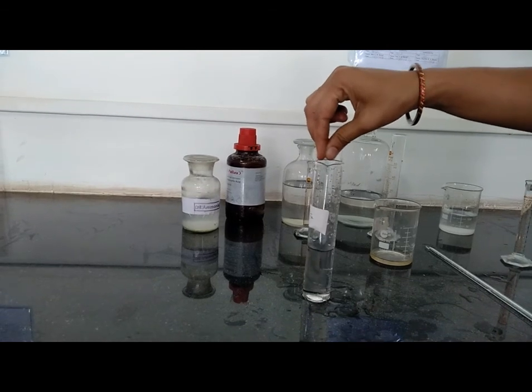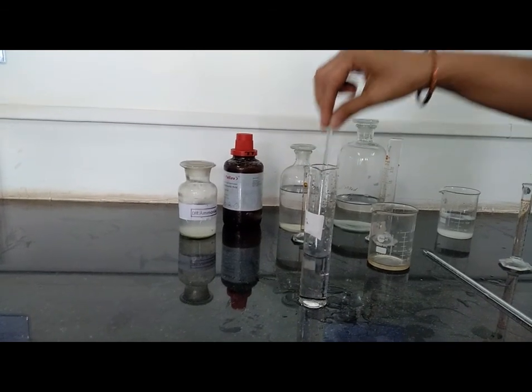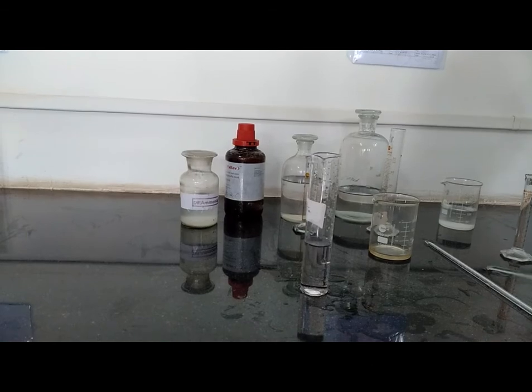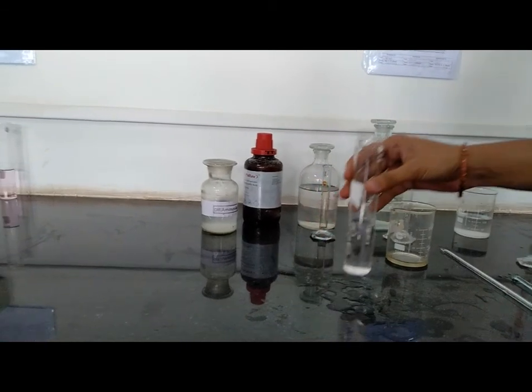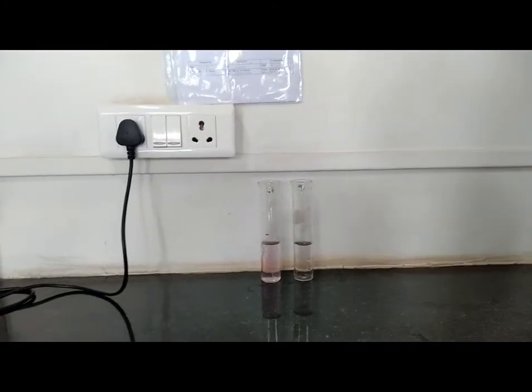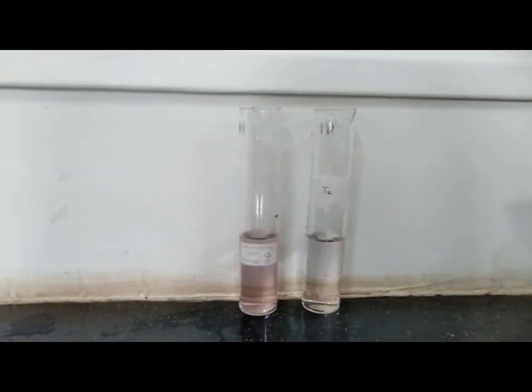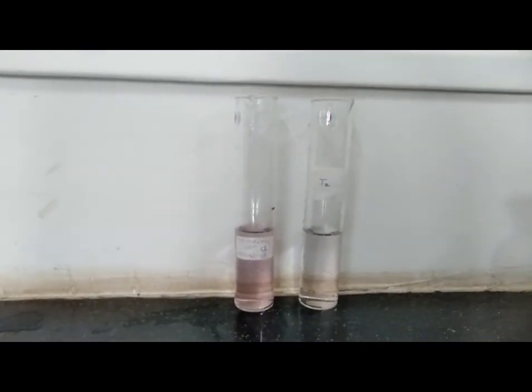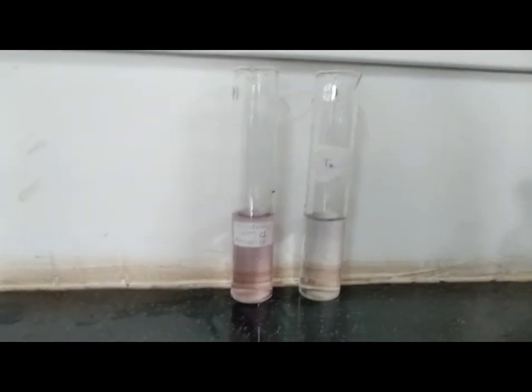Again mix it properly and allow to stand for 5 minutes. And then compare it against standard solution. Allow to stand for 5 minutes for the solution.